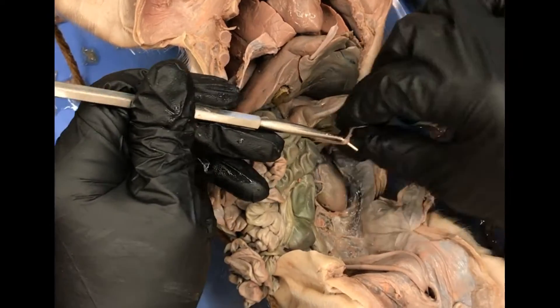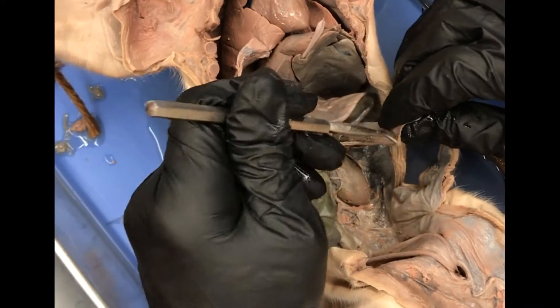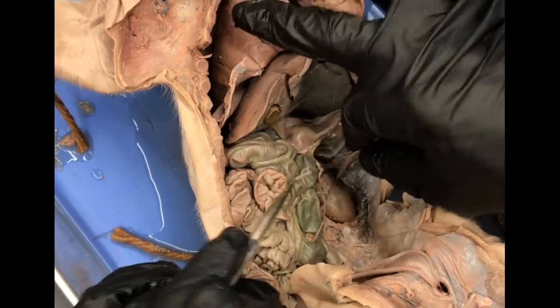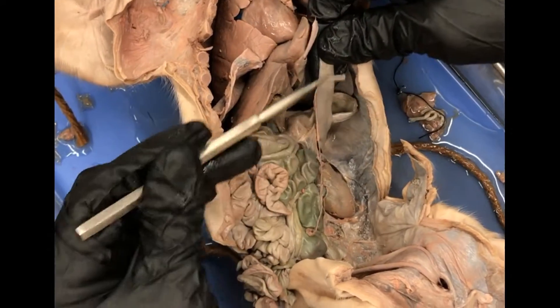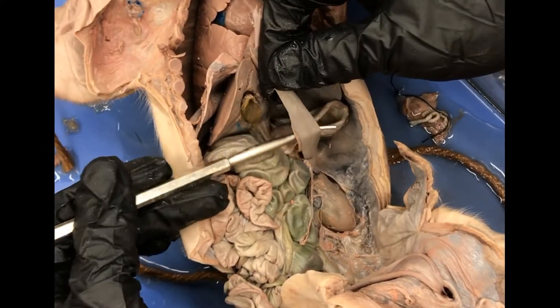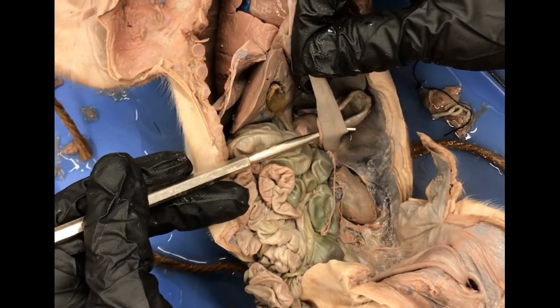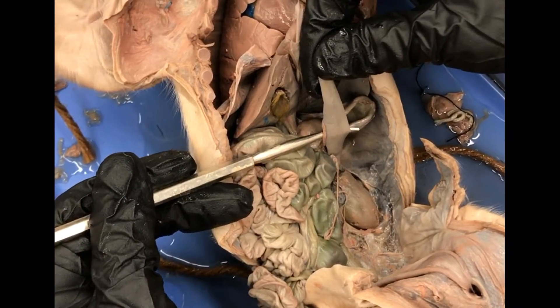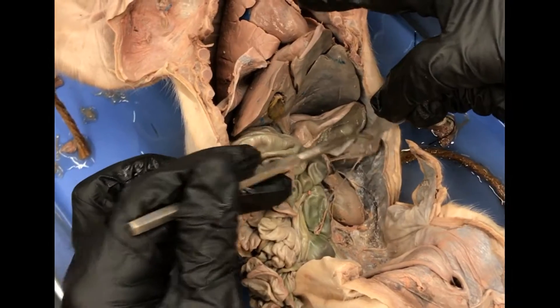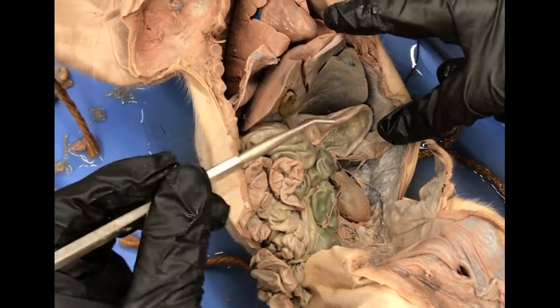Next to the stomach is this long structure here — this long thin one — this is the spleen, part of the lymphatic system. It's on the left side; it's only a left-sided structure. There's only one spleen.